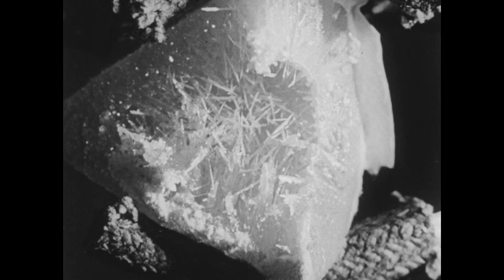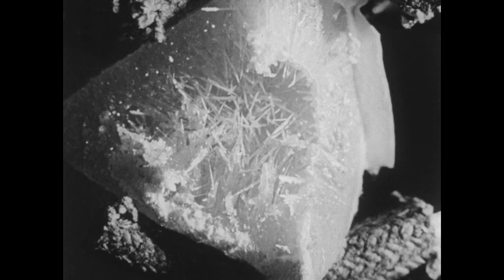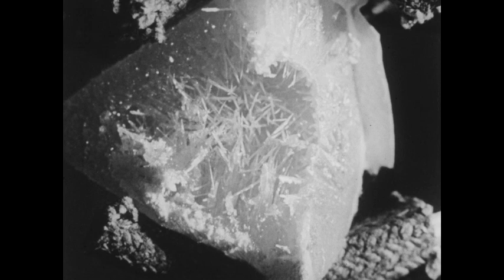If these crystals are permitted to stand at room temperature, they slowly change to the rhombic form, which is the stable form below 95 degrees. As this change takes place, the sulfur remains in the needle-like form, but the needles themselves become opaque due to the formation of many thousands of tiny crystals of rhombic sulfur, which are formed from the monoclinic sulfur.